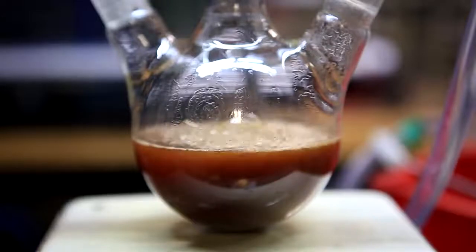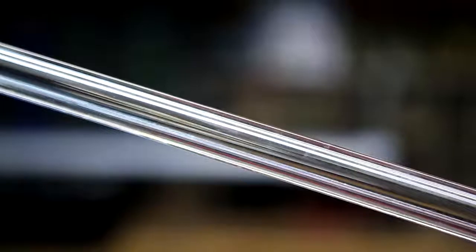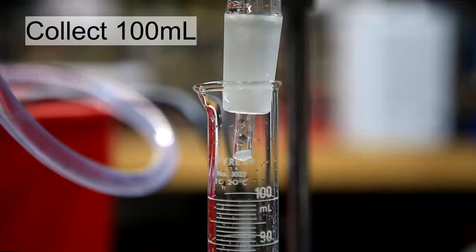During the distillation there will be a lot of bubbling, just make sure that there is no foaming. When the distillation started you'll notice a cloudy distillate traveling down your condenser column. 100 milliliters of this cloudy distillate was collected.